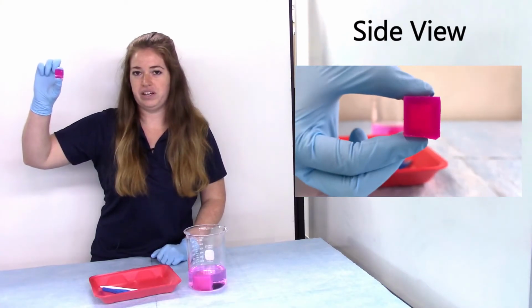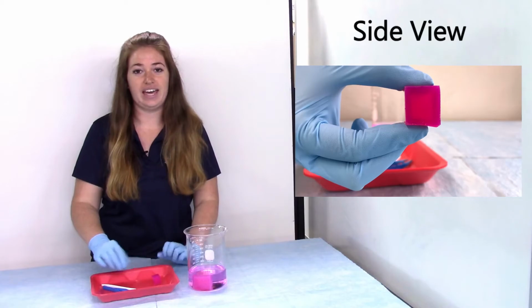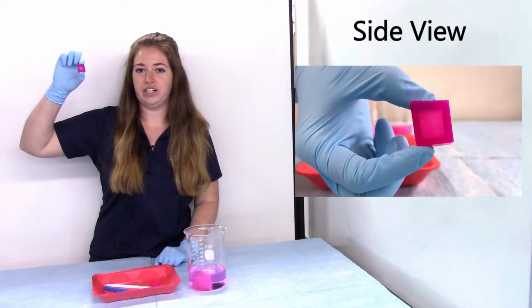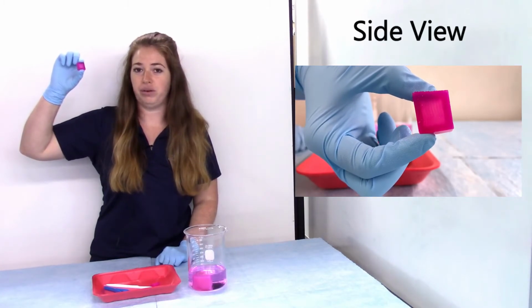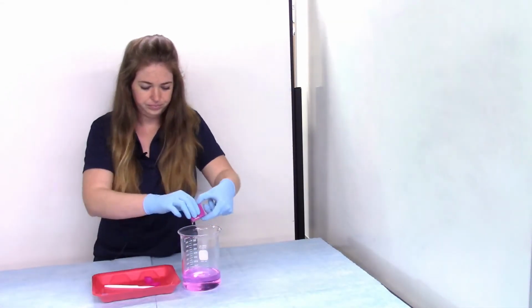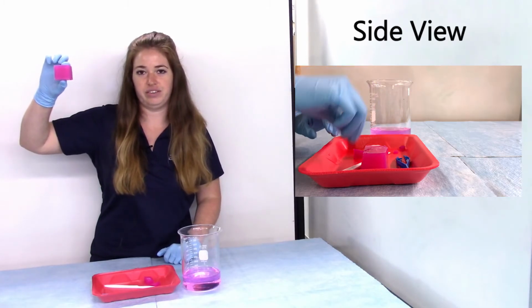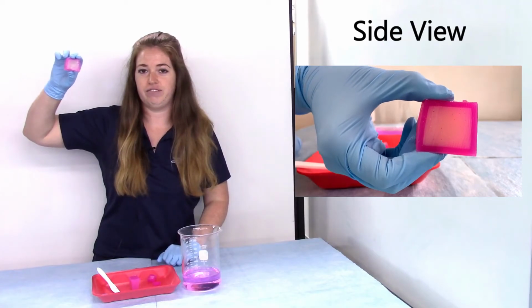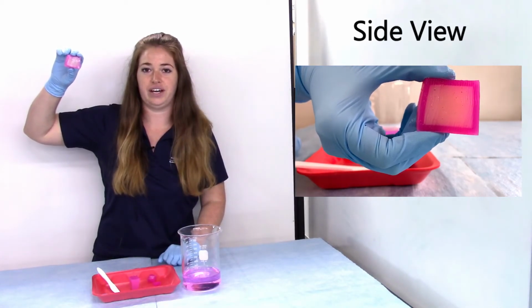Alright, and here's our medium-sized cube. So again, I'm going to cut it in half, and we're going to look at the inside. This cube looks different. The pink has not made its way all the way through the cube. The middle remains colorless. Let's take a look at our last cube. So here's our last cube. Again, it looks pink on the outside, but let's cut it down the middle. So in the center of this one, we have a very large colorless region. The pink is really only on the outside of the cube.